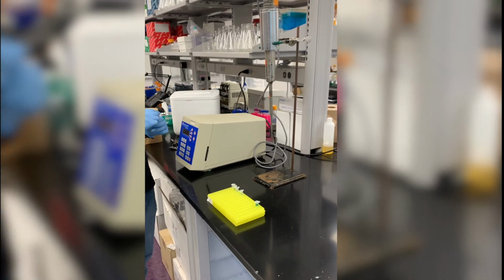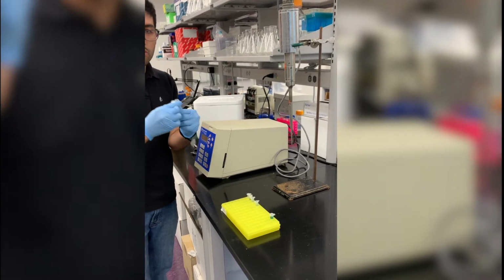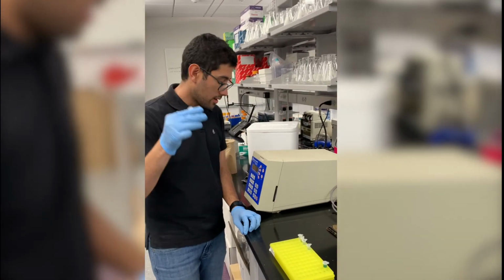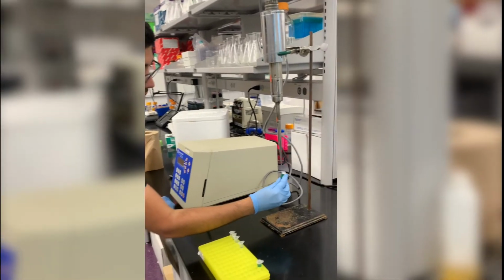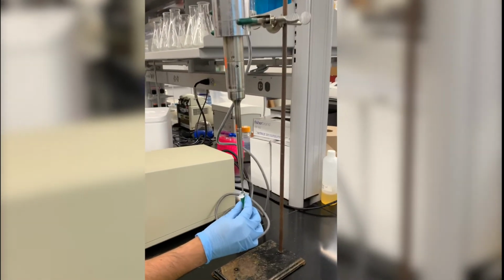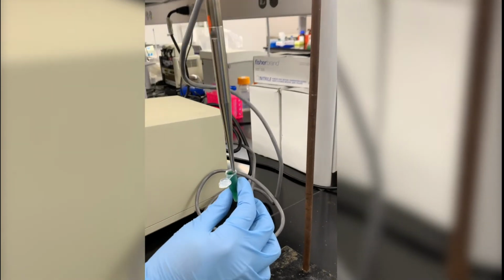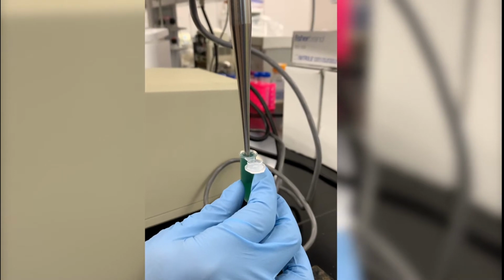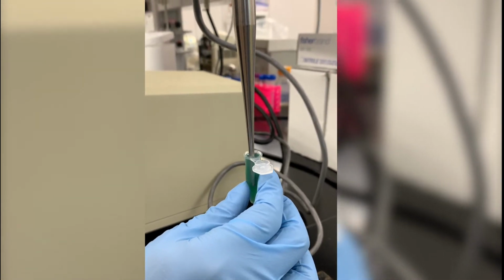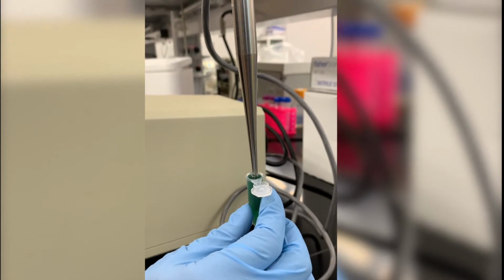So right now we're going to take our liquid, these are the cells that are intact, and then we are going to use the sound waves to break them open. I am going to use a power of 35 watts. As you can see, we apply different pulses so we can break the cells open.